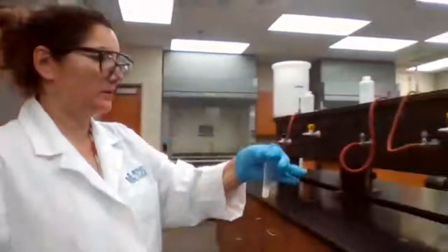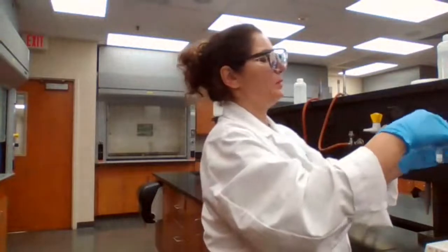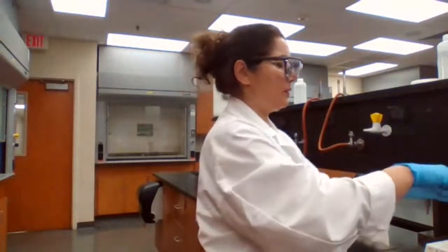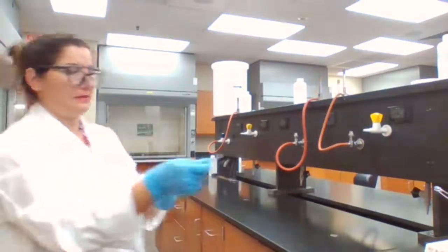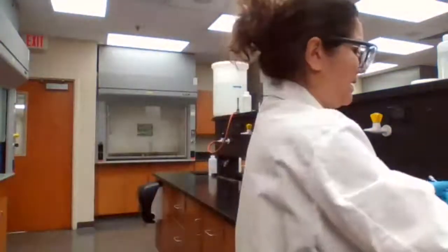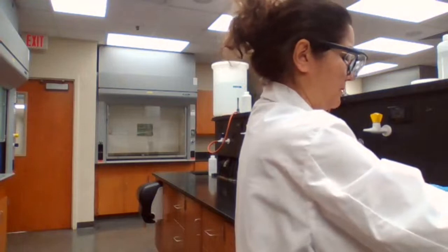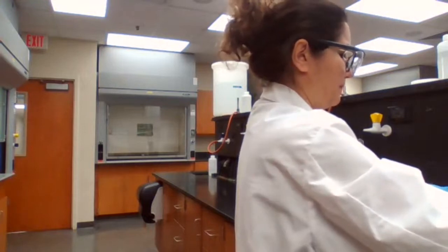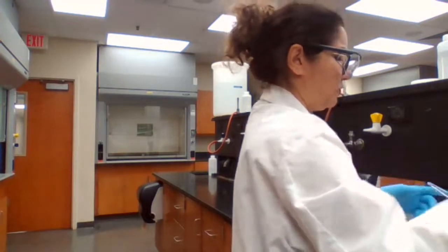I added hot water, the procedure, or you could add cold water and then heat it up, but I added hot water and I'm going to keep it in the hot water bath to make sure that the lead chloride dissolves. Keep it for 1 minute in hot water bath. We're going to keep it for 1 minute. So I time it for 1 minute and keep it in the hot water bath.